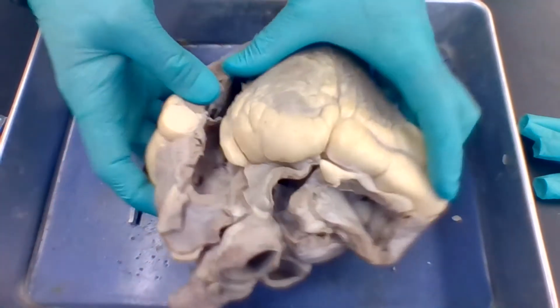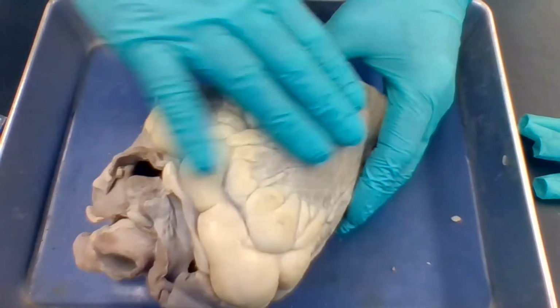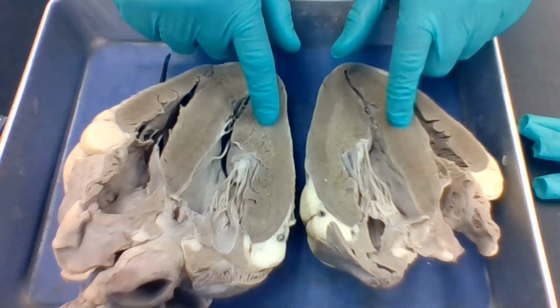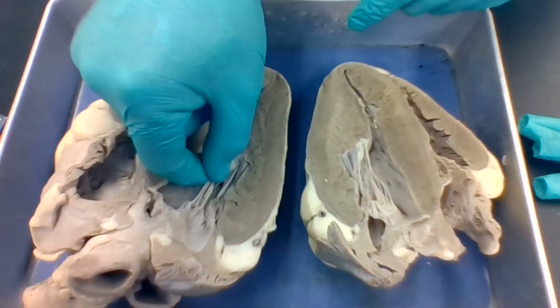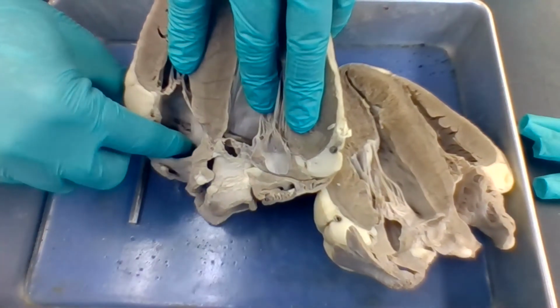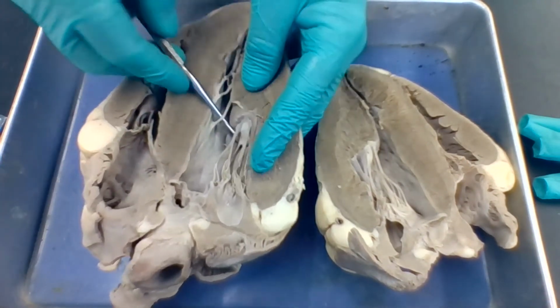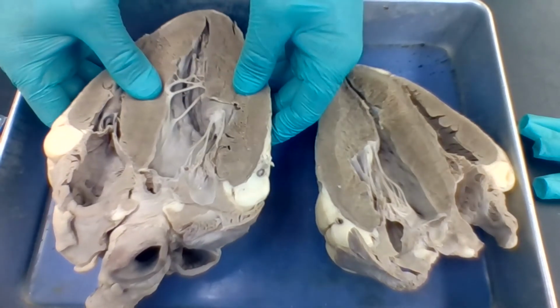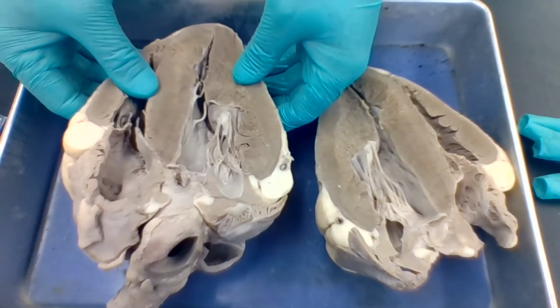Okay, so let's go over some parts here again. So let's do the layers. So there's 3 layers of the heart. So this would be the epicardium. Epicardium is the outside. Muscle, myocardium. That's all of the muscle of the heart. And the endocardium, that's the inner layer here. Okay, we got chordae tendineae, papillary muscles. Up here in the atria, these are called pectinate muscles. Okay, this stuff here that does not connect to a valve, this is called trabeculae carneae. And one purpose for those is to keep the heart walls from sticking together when they contract like that.